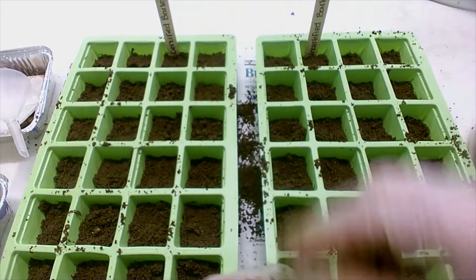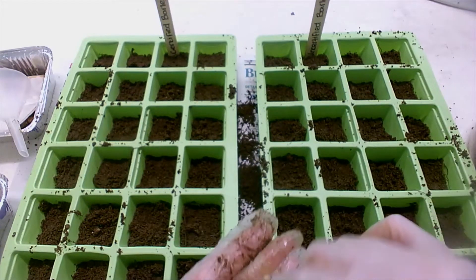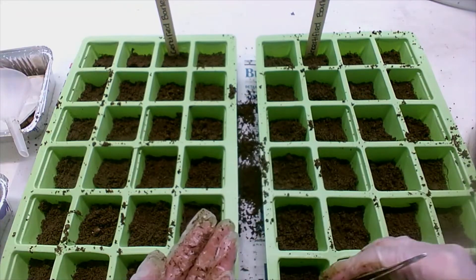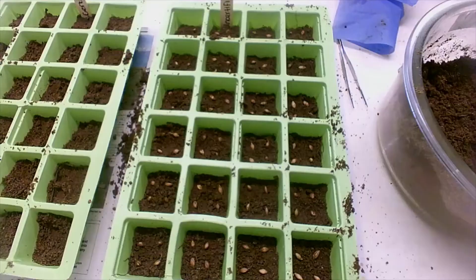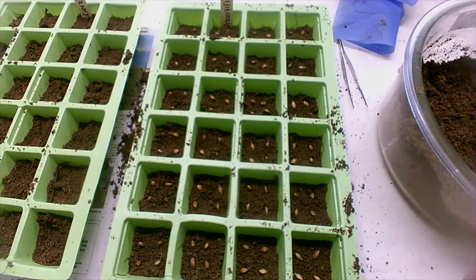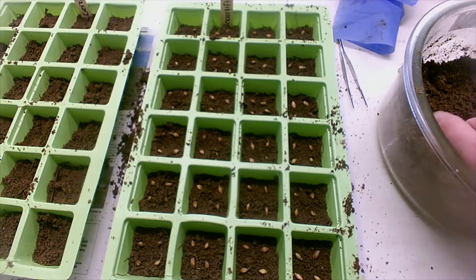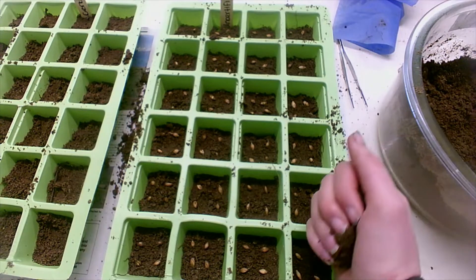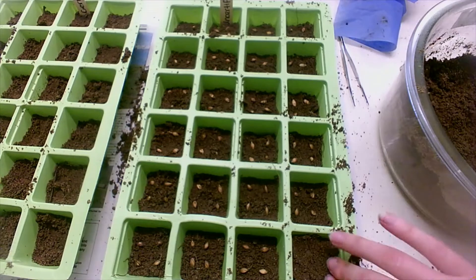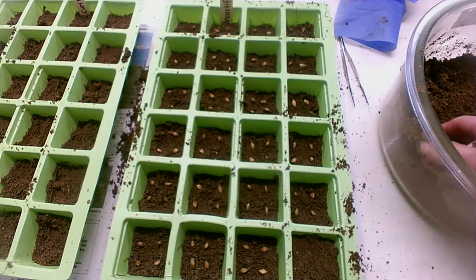So this is my uncertified one. I'm going to put four seeds of barley just on top of the soil. I have four in each pot. I have to make sure that they have the same amount of spacing between each one, or at least try to. And then I'm going to apply about three centimetres of soil on top of each one, and then press it to make sure that there is good soil-to-seed contact.